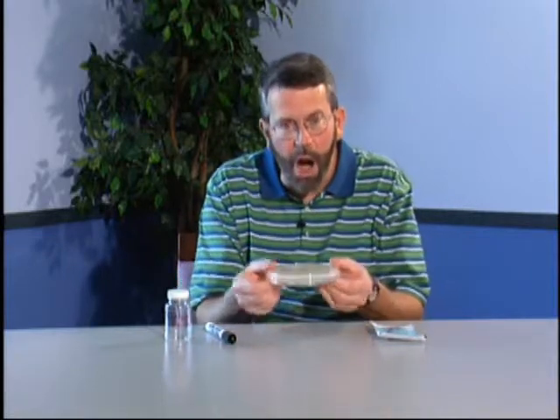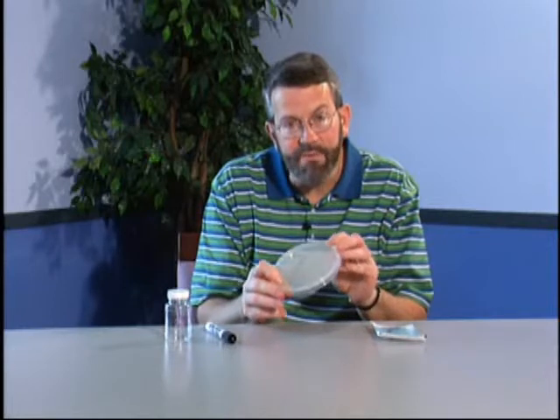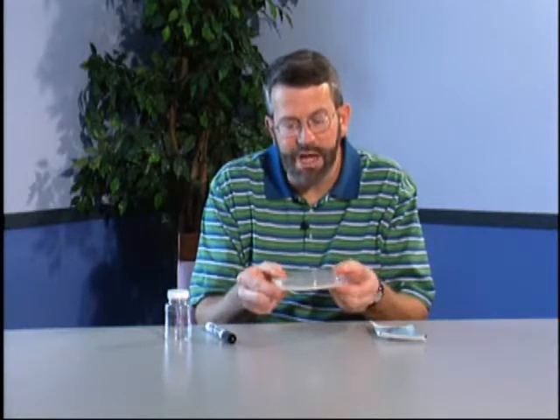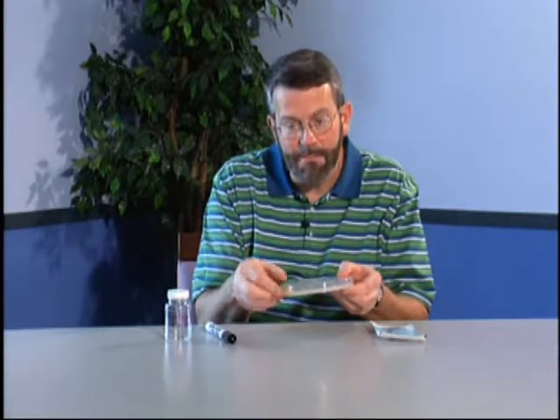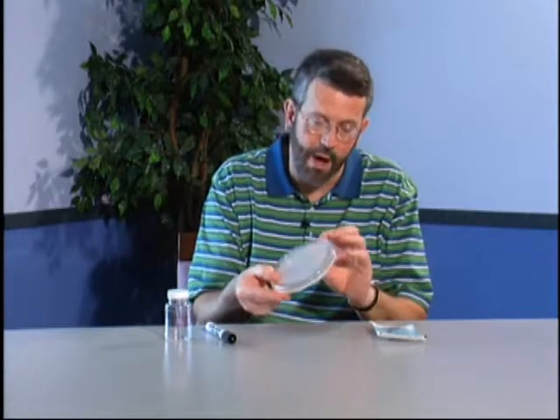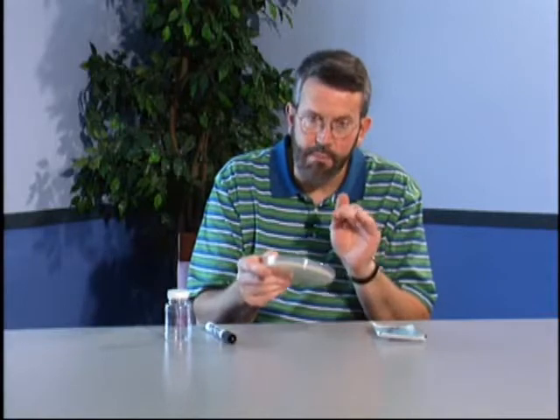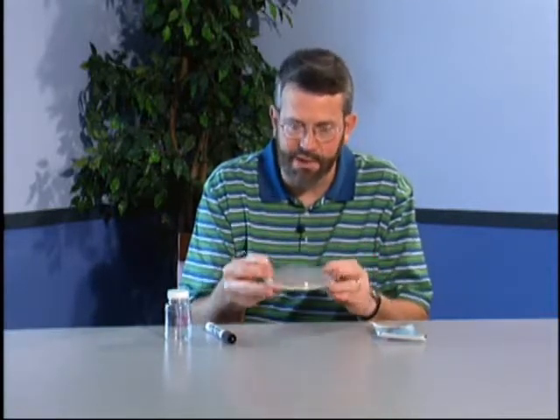We're going to do a little experiment today. I have here with me some agar. An agar is a medium for growing bacteria. This is sterile. If I open this, bacteria will start growing in there if they're inoculated onto the agar. So you open this up, you put whatever you want to try to plate out on there, then you incubate it 24 hours and you look for bacterial colonies. So this is a standard test in many labs for bacteria.